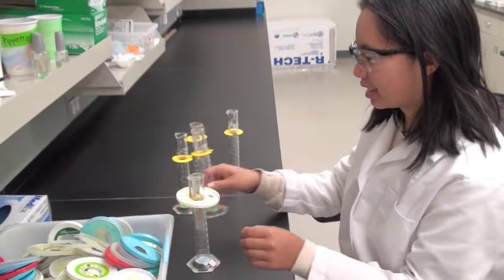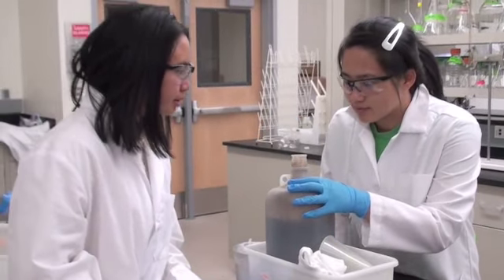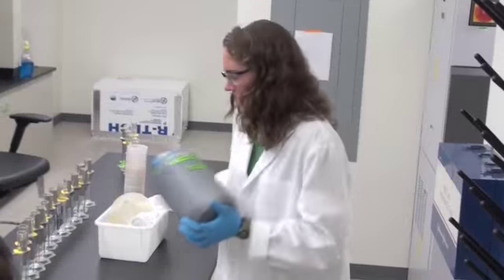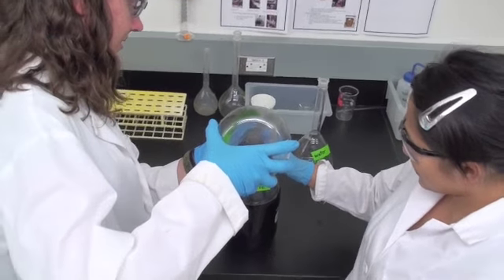Place the samples into the correctly marked graduated cylinders. Care should be taken to avoid getting the biosolids in one's mouth or eyes, as anaerobic digester biosolids may have an unpleasant odor. The experimental setup should be performed in a well-ventilated laboratory. The anaerobic biosolids are removed from the temperature control room, vigorously shaken, and filtered using a sieve. We have found that diluting our biosolids works well.